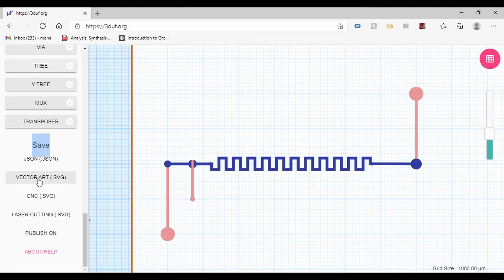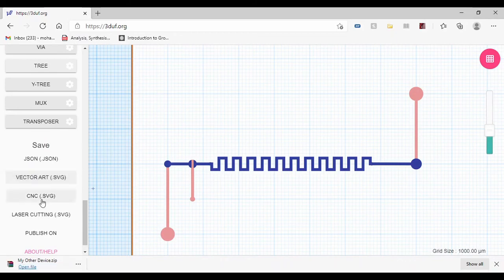And this is going to be a problem, especially since microfluids are very specific designs. But again, if you want to try the other two, the laser cutting and the vector art, they might work for you. What worked best for me for laser cutting is this file format. So after I download it, I'm gonna get a zip file that I can use in Inkscape to modify if I need to, or I can import this zip file into my laser cutting software so I can start cutting my microfluid device.